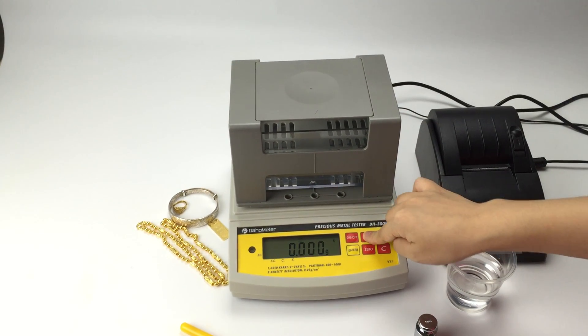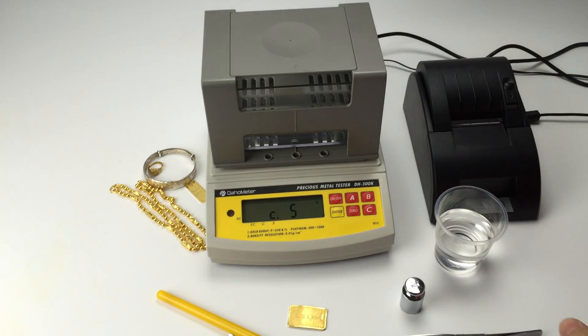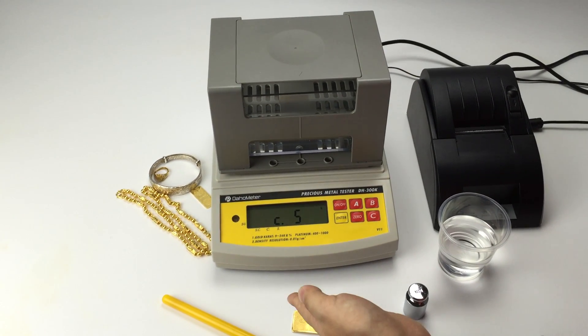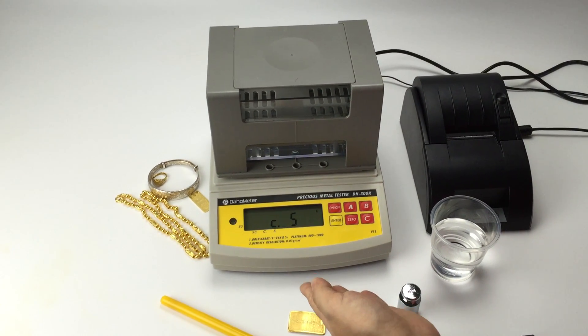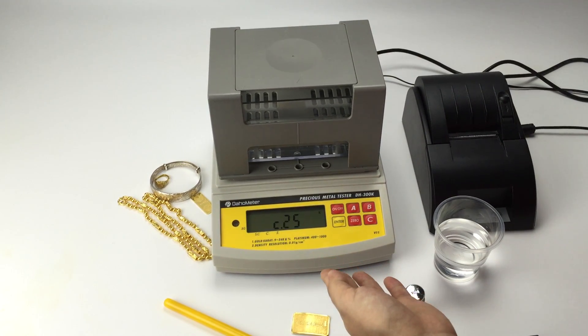Long press A. You can see the data 25. That is the default temperature for this machine.